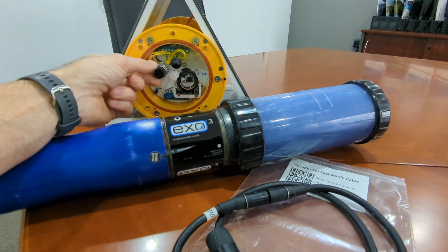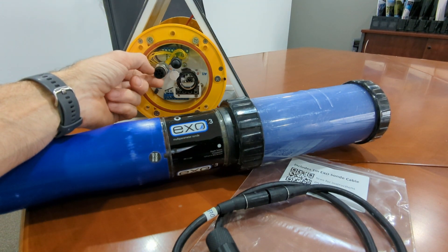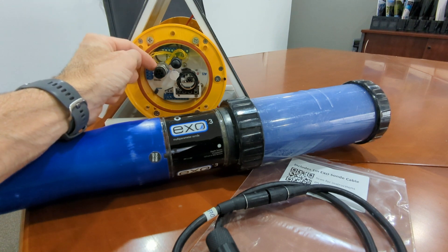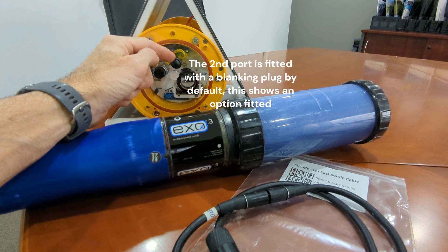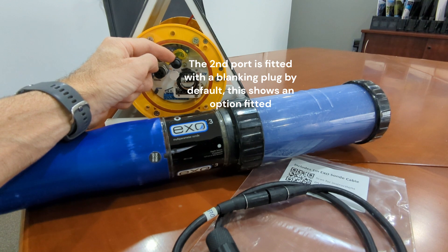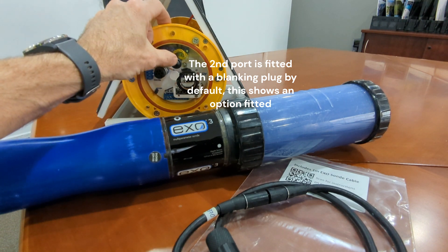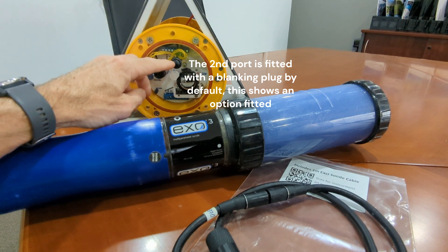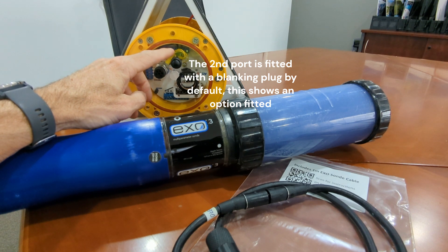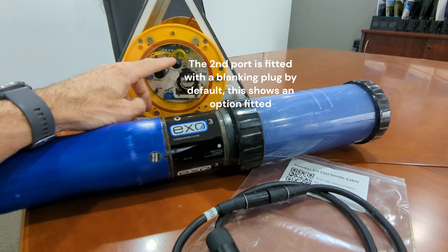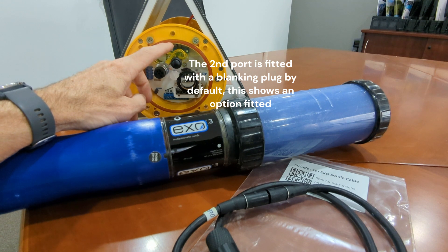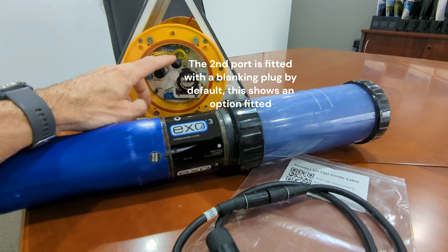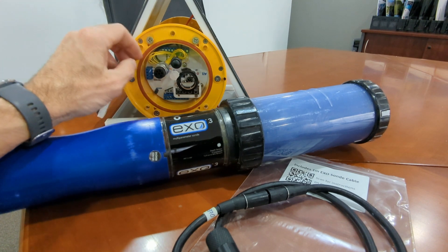The standard AI-1 has a 6-pin microcircular wetmate connector on the bulkhead. A second port is pre-drilled which can be fitted with other options including a push-button switch, another 6-pin connector such as for two sondes used at different depths, or a bulkhead for a Doppler current sensor DCS.